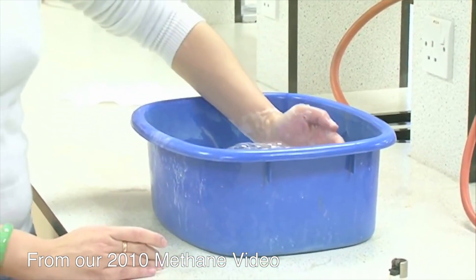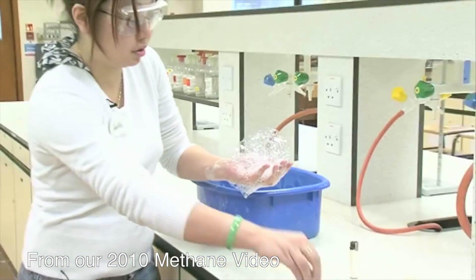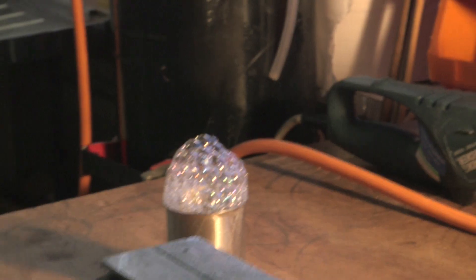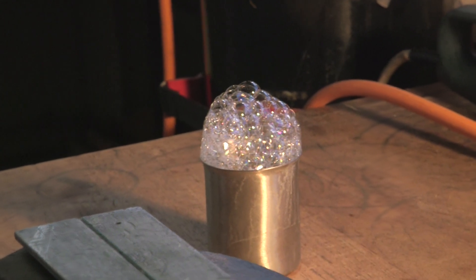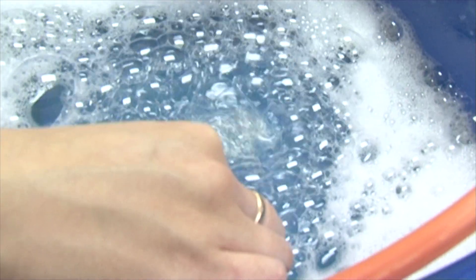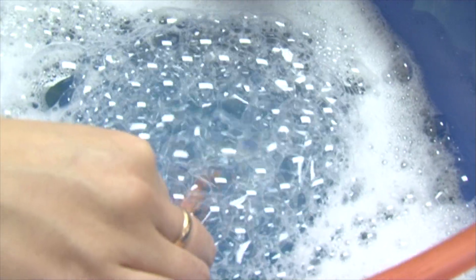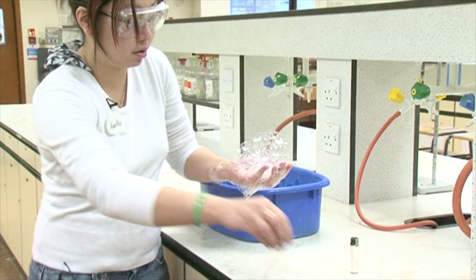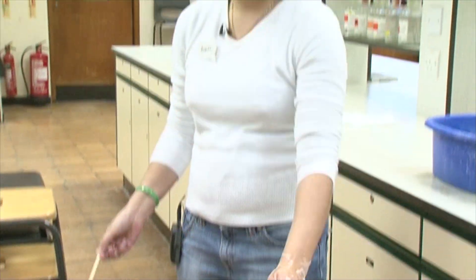In fact, Sam Tang has done it on her hand — the heat is not enough to damage you. But when you do it with oxygen and methane, the amount of heat liberated is exactly the same, except it liberates the heat very rapidly, giving a big pulse of heat. With pure methane bubbles, the methane is not mixed with the air, so it takes time for oxygen from the air to diffuse in, and it burns relatively slowly.